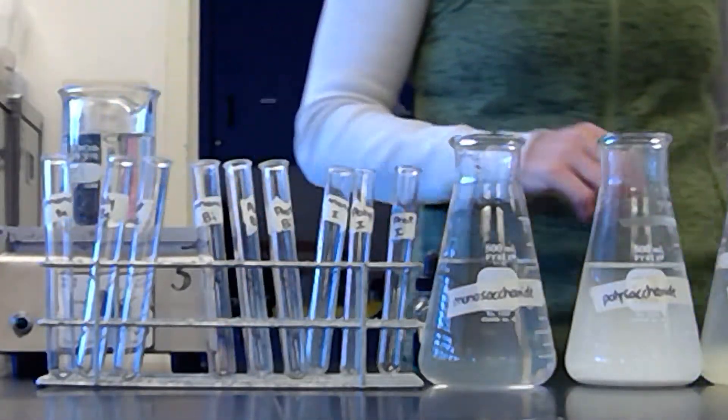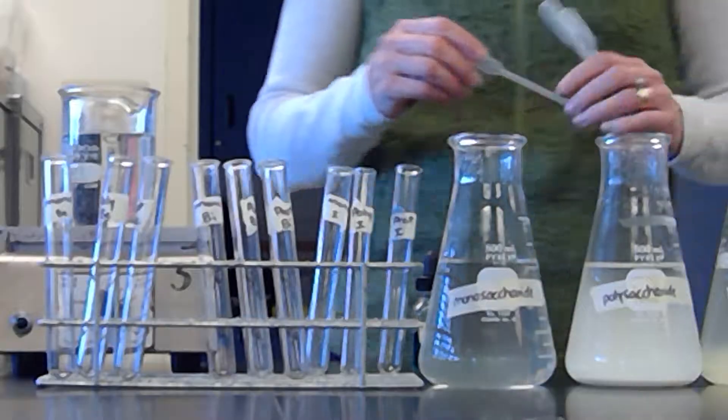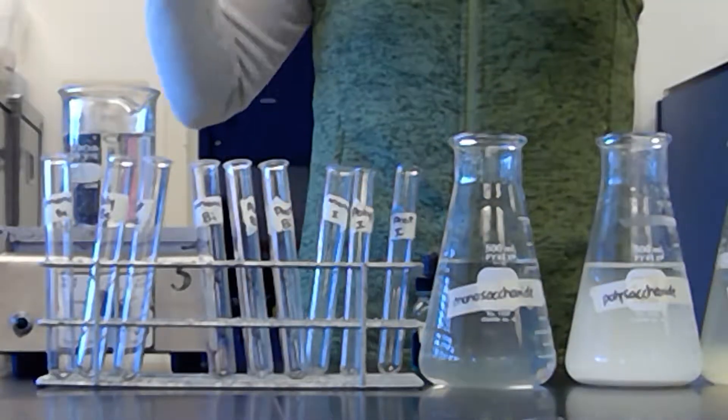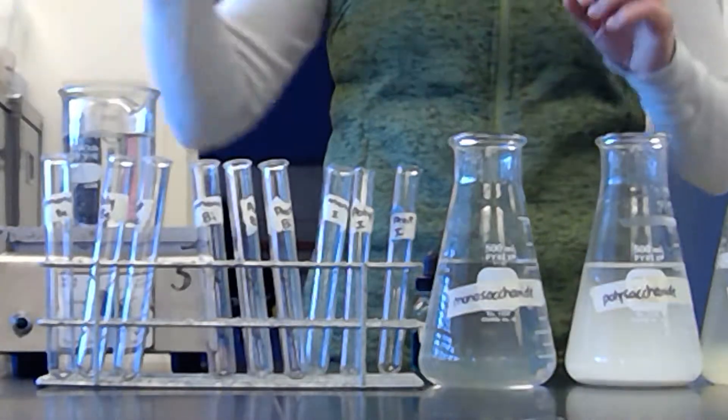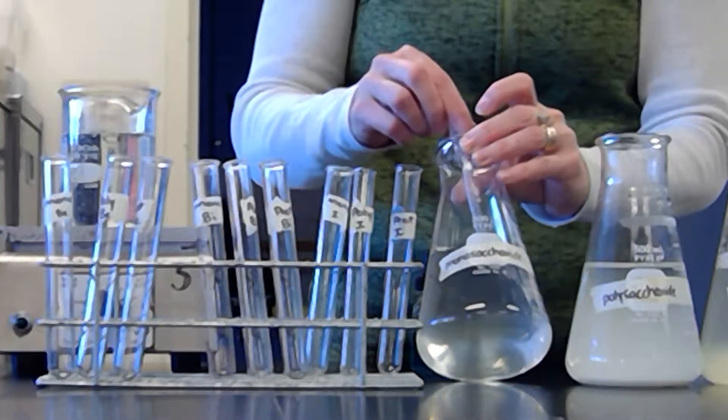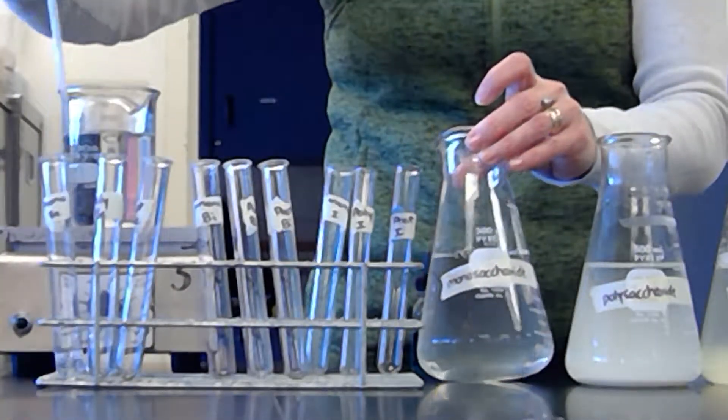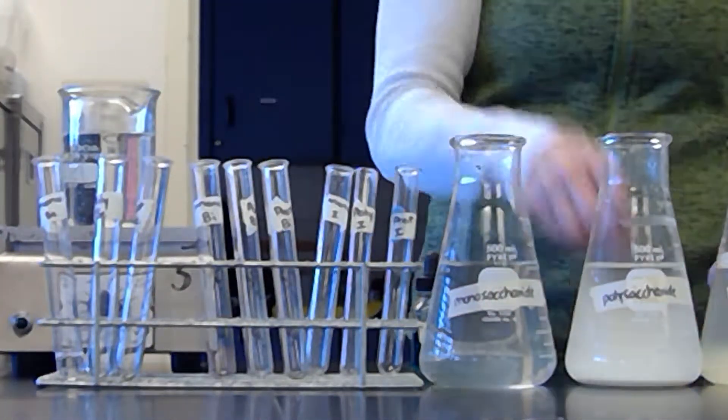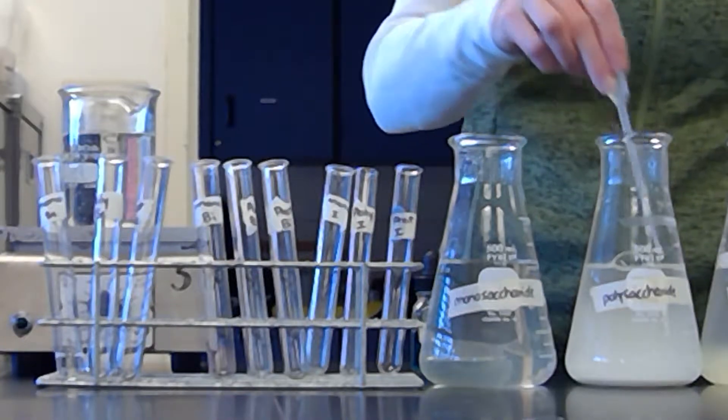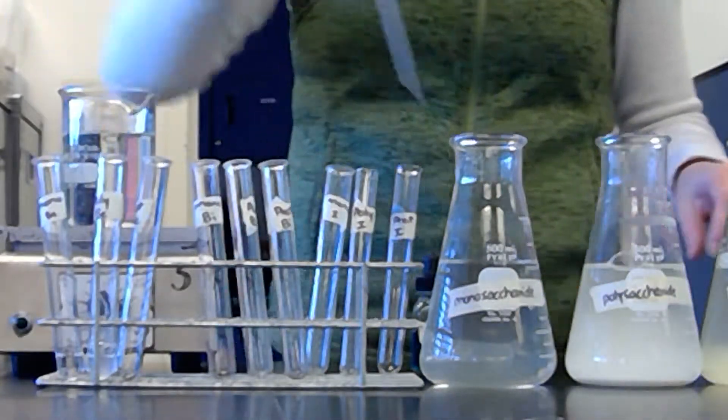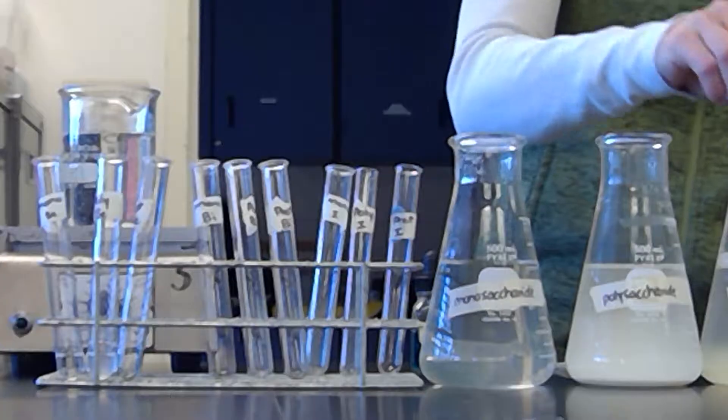So we'll do one at a time. The reason that I do Benedict's first is because it has to sit for five minutes in warm water, which is what's heating up here in the beaker. So I'll just take a healthy squirt of each one.